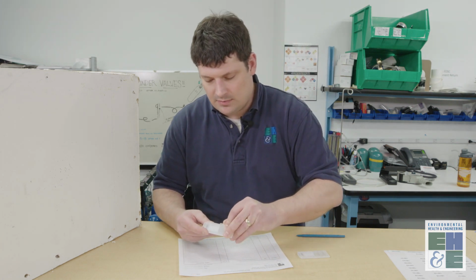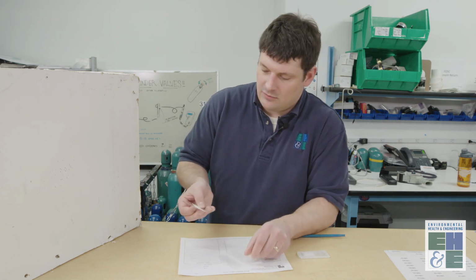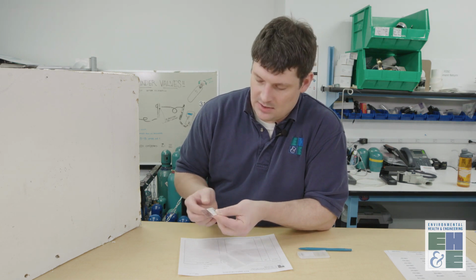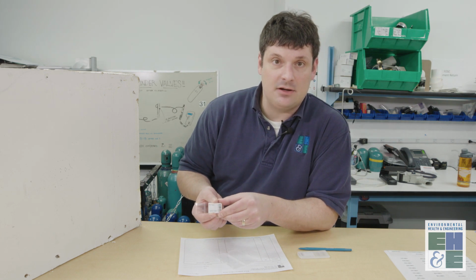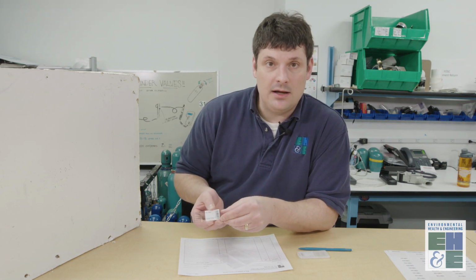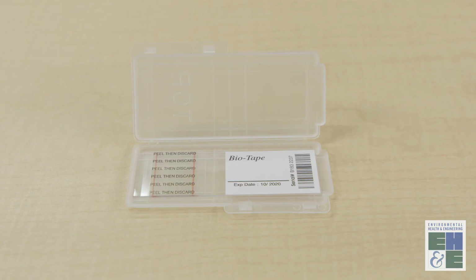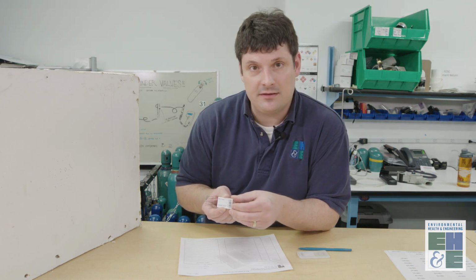When you open a sample, it is a small microscope slide that has a little bit of flexibility to it. When you're collecting these samples, you want to make sure your hands are clean or use gloves. Each slide has an expiration date, so make sure that the expiration date isn't passed for all the slides that you're going to collect on a project.